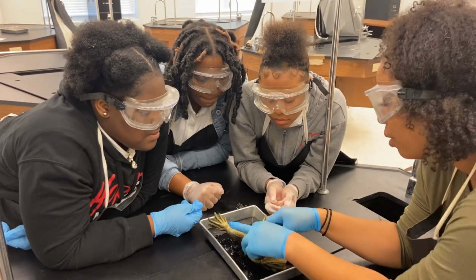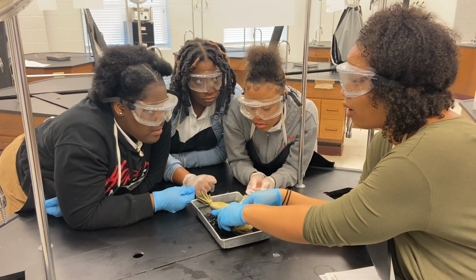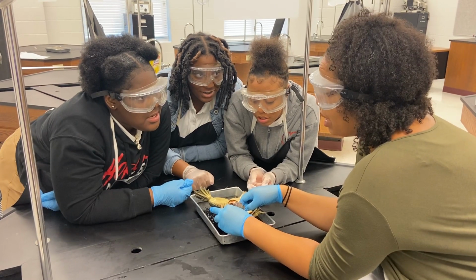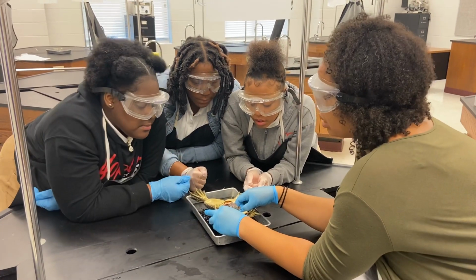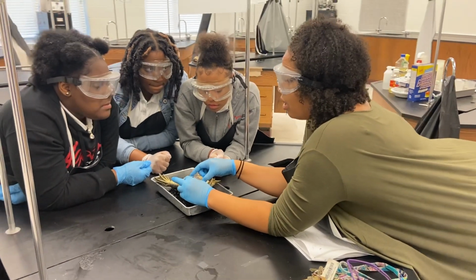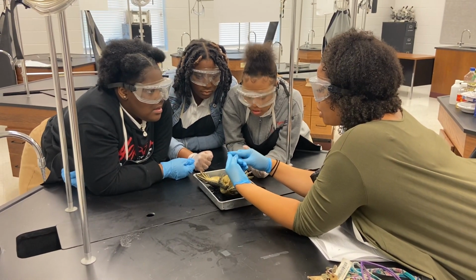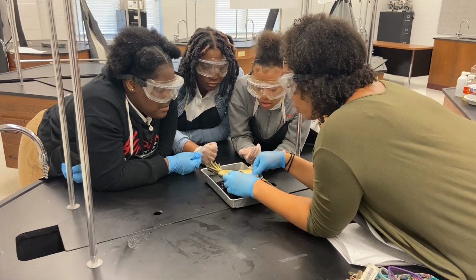Okay, so if I were to pull up my intestines, I would find two structures on the very back of the frog, and that would be what? The kidneys. And the kidney is a part of what system? The excretory. Because excrete means to do what? Exit or get rid of something. And what are you getting rid of through your kidneys? Waste. Good. What other structure, it starts with a C, is on the frog, and it's like an exit way, a passageway? The cloaca. Good. So that's the way for the excretory system. And what's the other system? Reproductive. Good job.